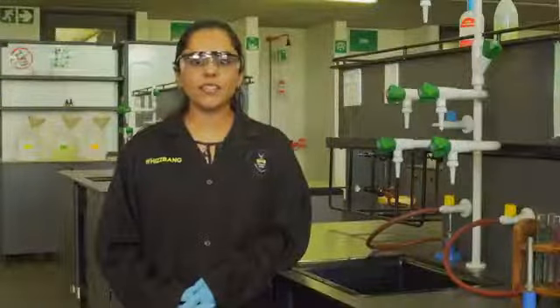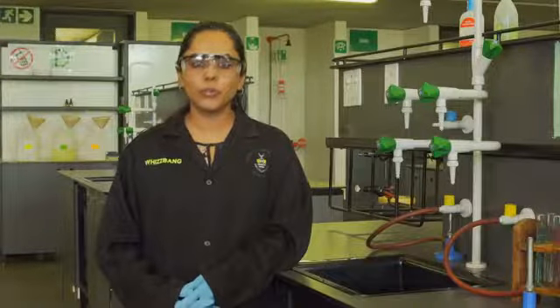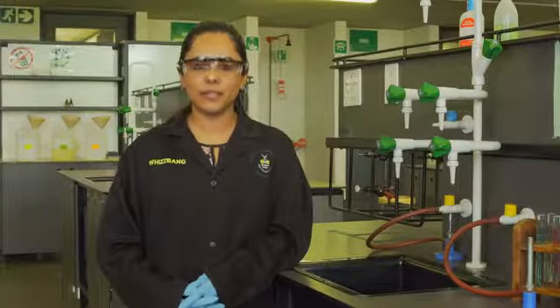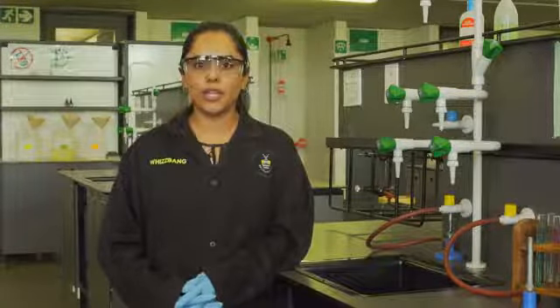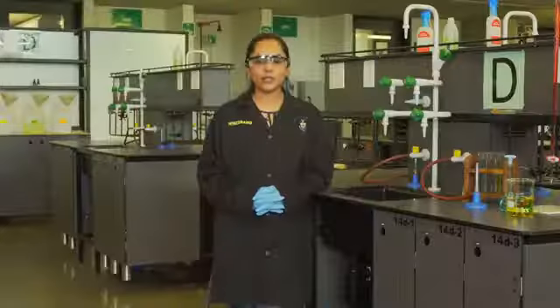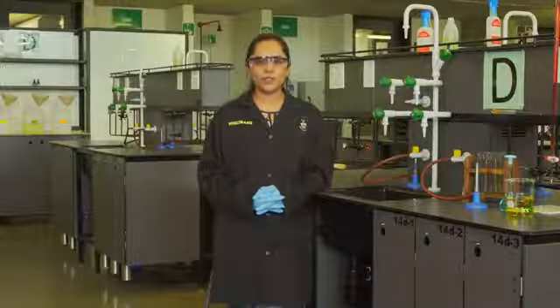At the start of each lab session, you will be told which chemical wastes are hazardous and should be disposed of in the waste containers provided. Always ask if you are unsure of where to dispose of waste. And this video concludes waste disposal in the chemistry lab.